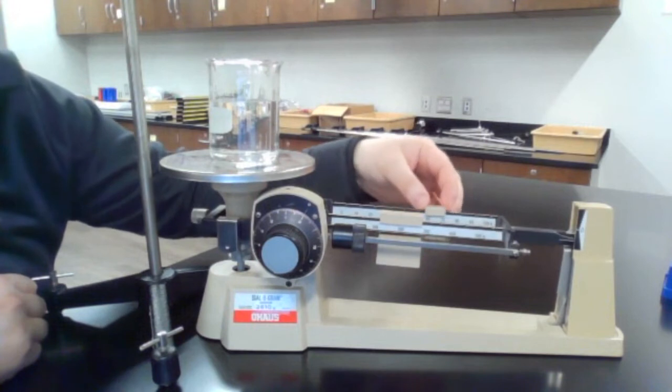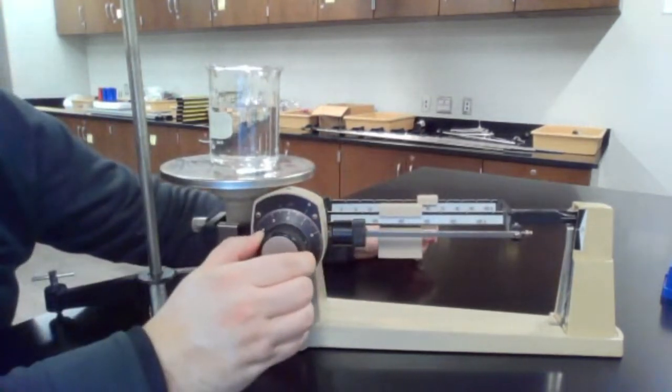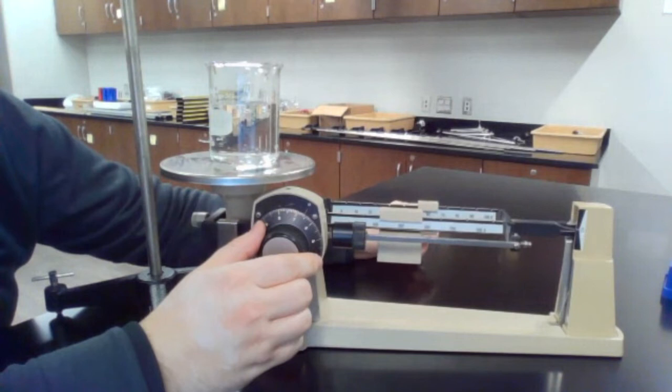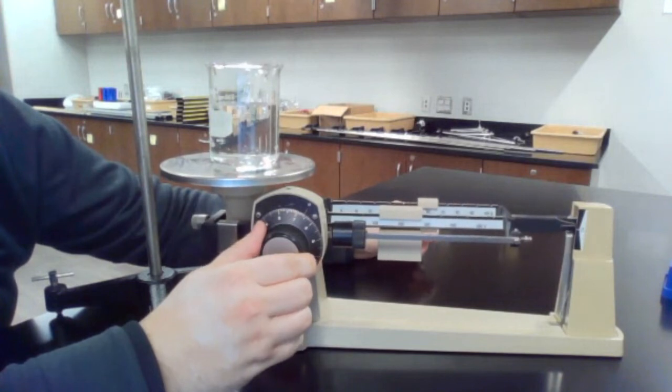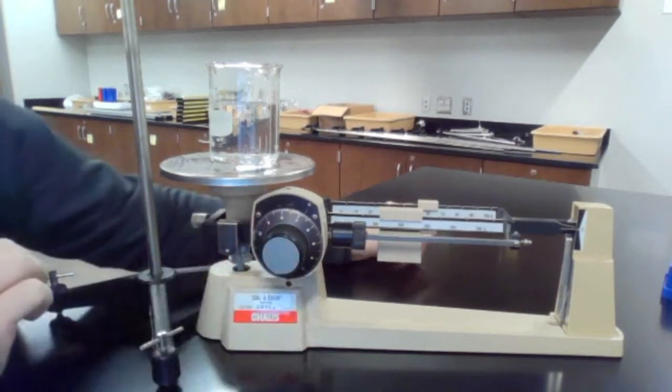All right, so it's less than 270. All right, that looks pretty close.